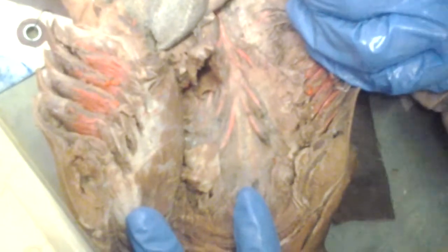All right. So can we turn to the blood vessel? Yes, turn to the branchial. Keep going. It's in the circulatory system. Can we see the afferent just by looking at this? Go back. There we go. Open that up. All right.